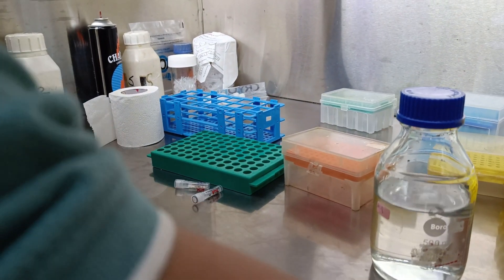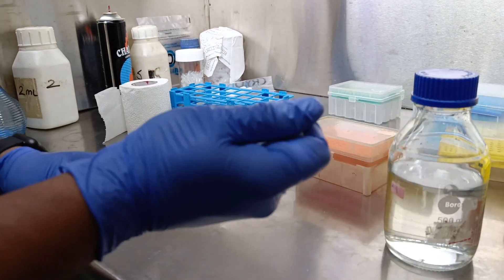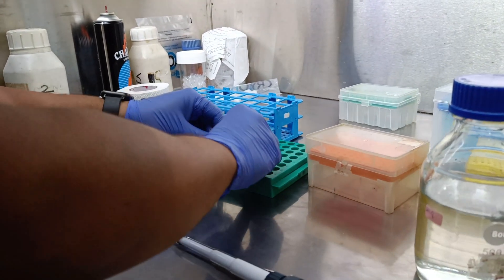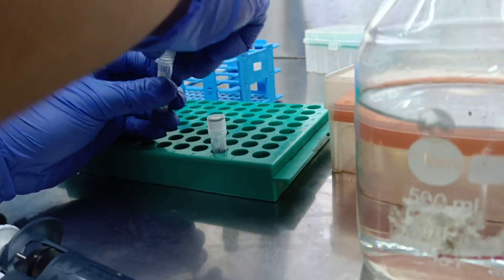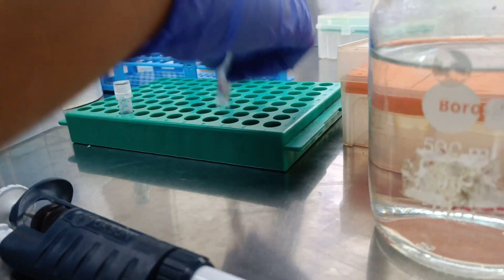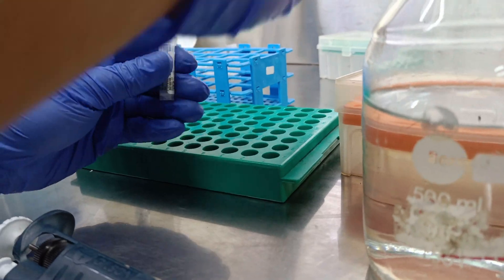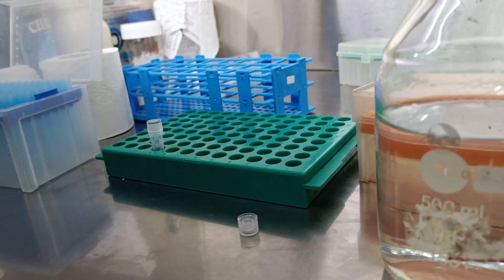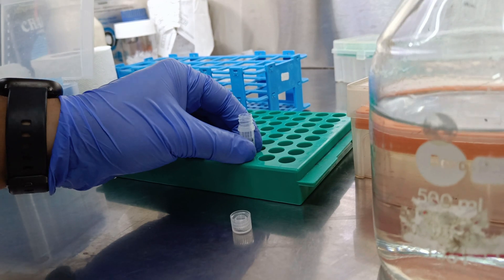We need to make a few new primer stocks for PCR. We just need to add some sterile DNase-free water to make a 100 micromolar stock solution, and from that we will make a working concentration of 10 micromolar to use in the thermocycler reaction.